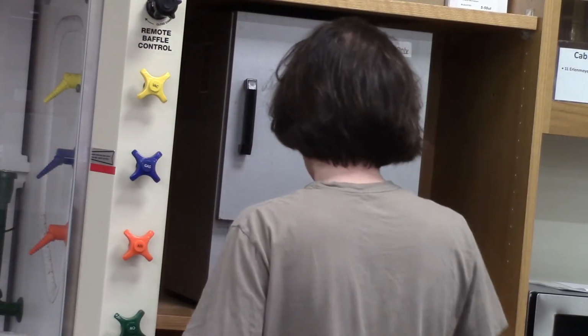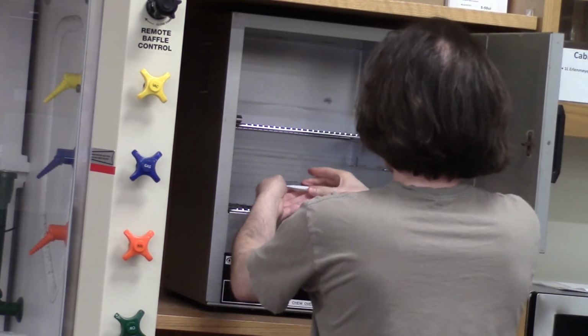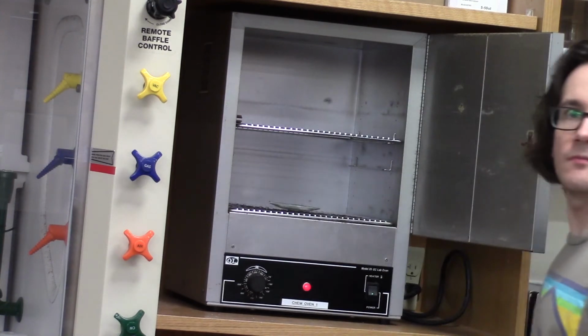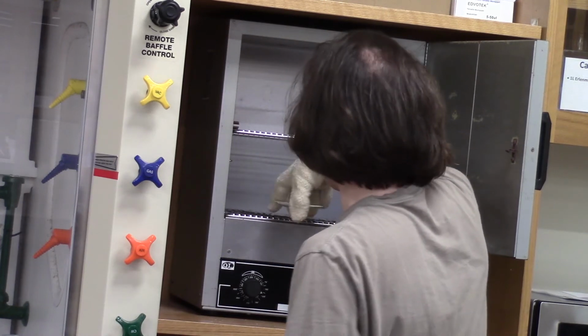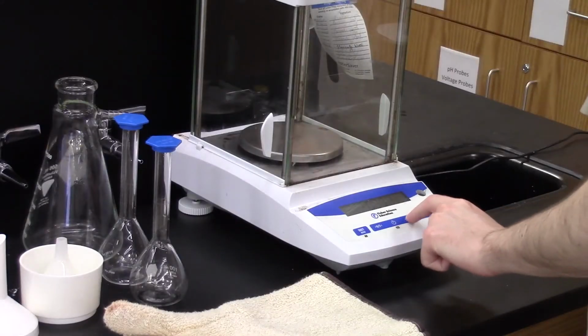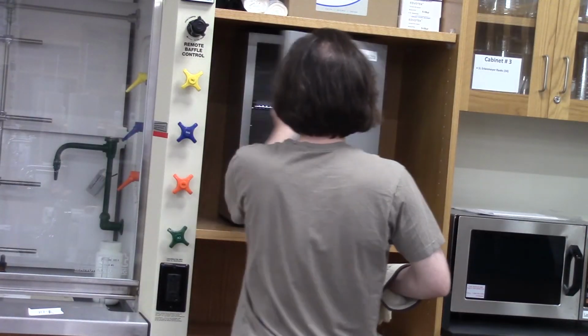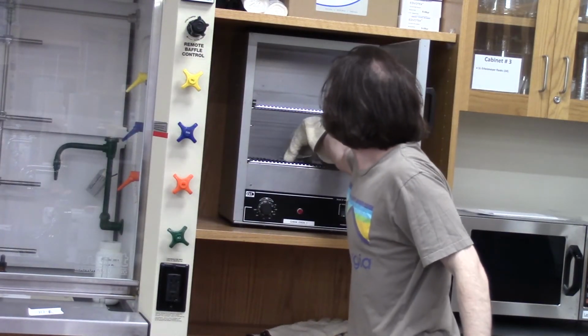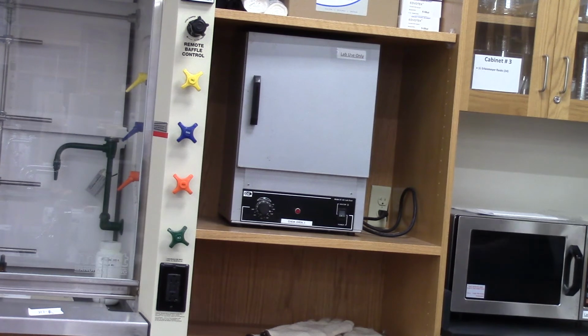If we weigh our product right now, there will still be residual water that will artificially inflate the mass. To address this problem, the product is placed in a lab oven set just above the boiling point of water. After about 10 to 15 minutes, the product is removed from the oven and weighed. The product is returned to the oven to dry for about 10 more minutes. We will know all of the water has evaporated once the mass of the product stops decreasing between oven cycles.